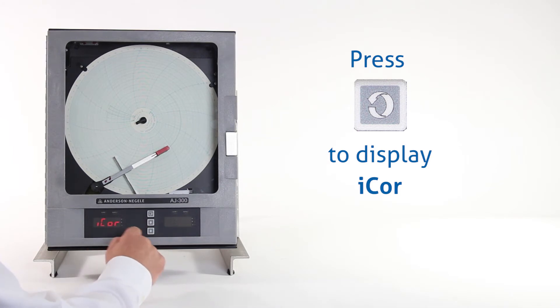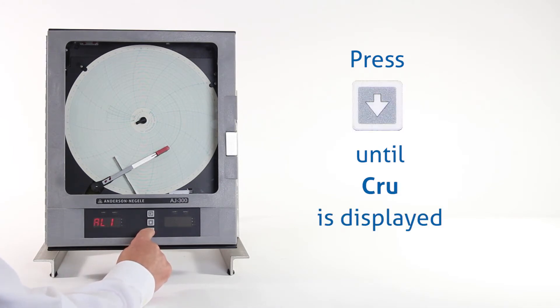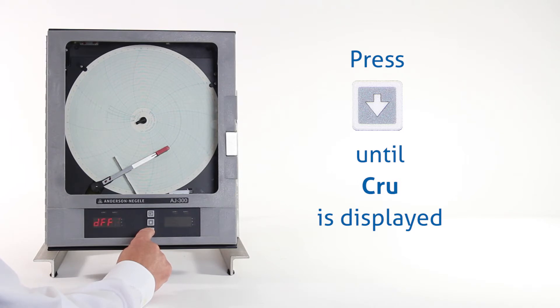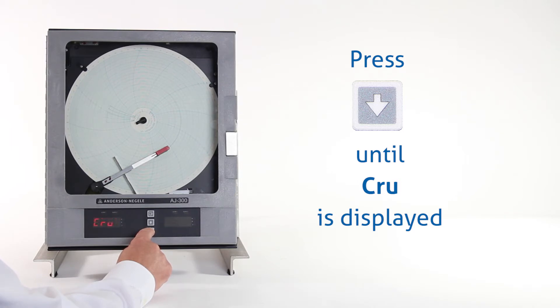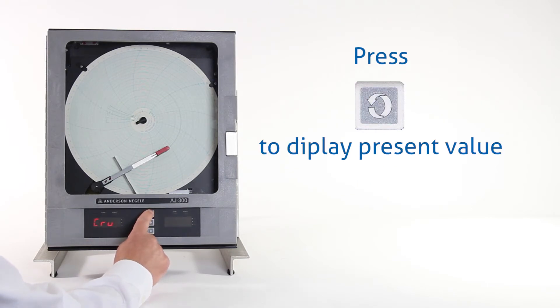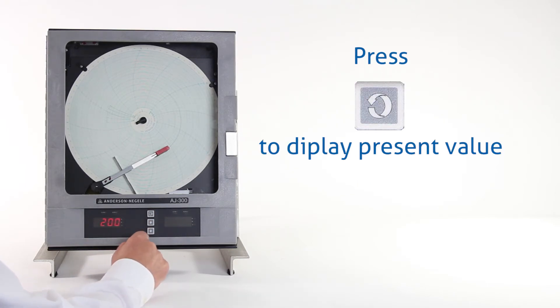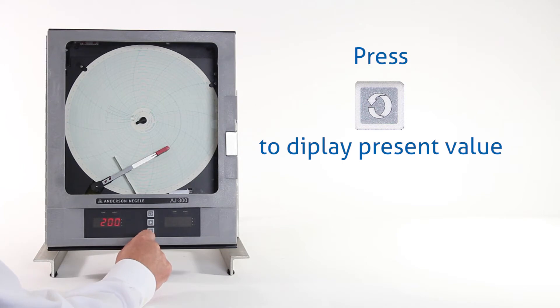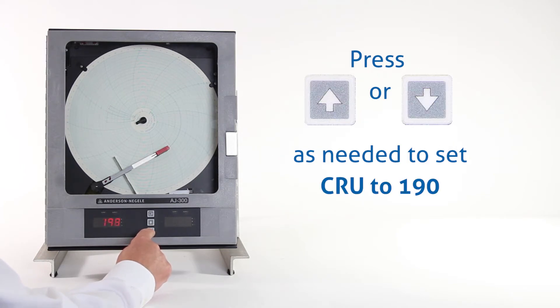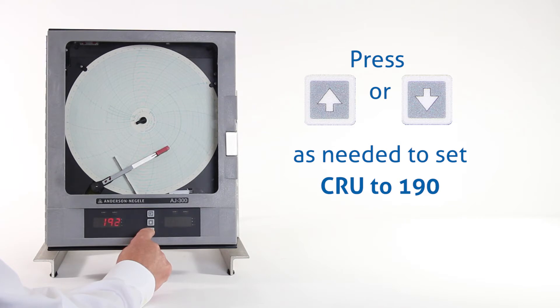We're going to see ICOR. We now press the down arrow key repeatedly until we get to CRU for chart range upper. Once we see CRU, we're going to press the scroll key, and we'll see a 200 there. We're using a 90 to 190 chart, so the chart range upper needs to be set to 190. Use the down arrow key to set that to 190.